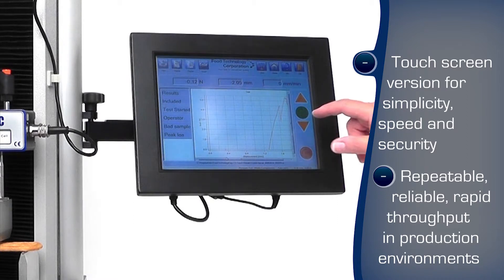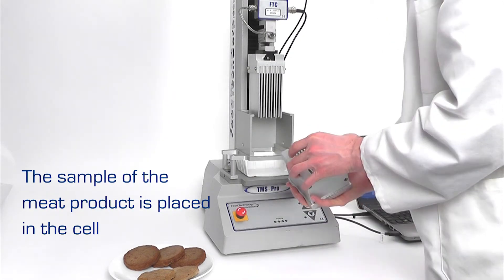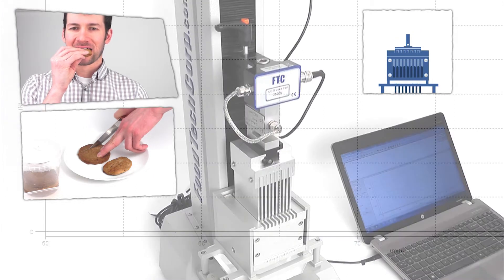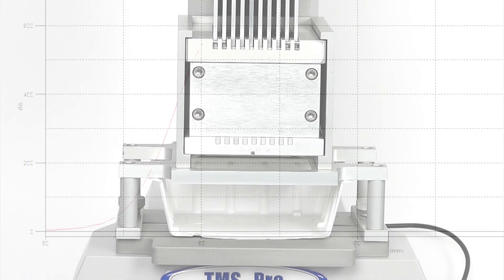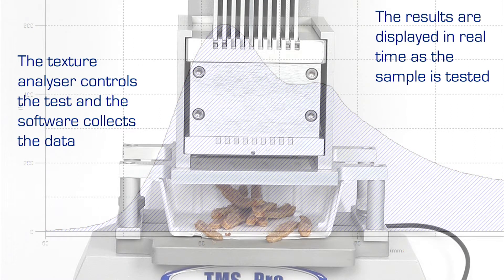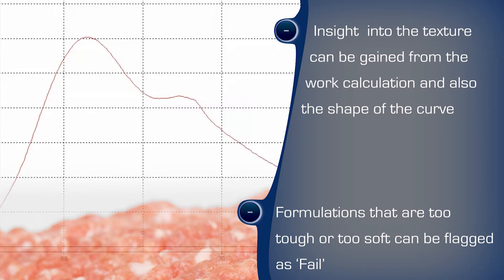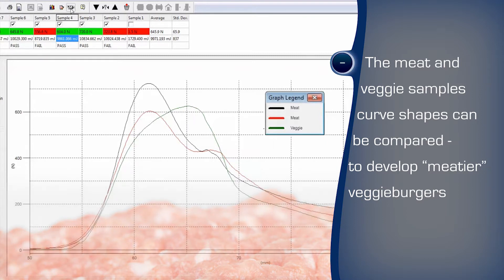The touch-screen controlled texture analyser runs tests at the push of a button with minimal training, ideal for production areas. The burgers were cooked as per the producer's preparation instructions and a similar amount for each variety placed in the sample container. The test procedure lowers the upper multi-blade part of the fixture through the sample to perform a complete stroke right through the burgers. Real-time graphing shows the behaviour of the sample under test, and features of the curve can be identified which indicate ideal or undesirable sensory characteristics, with calculated values correlated to preferred quality benchmarks. Further insight into texture can be gained from the work calculation and the shape of the curve, where particularly tough elements of the bulk would show local resistance effects. The texture analyser can repeat the test to allow comparison of the meat and veggie samples.